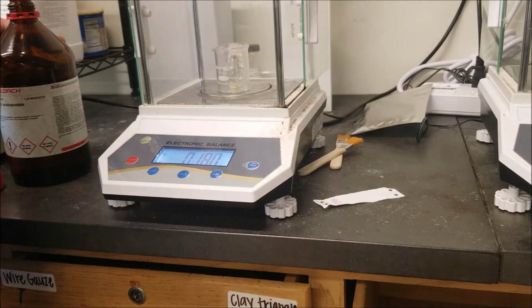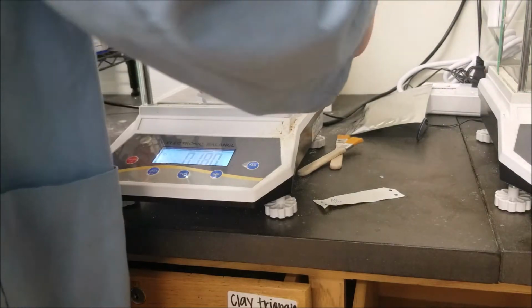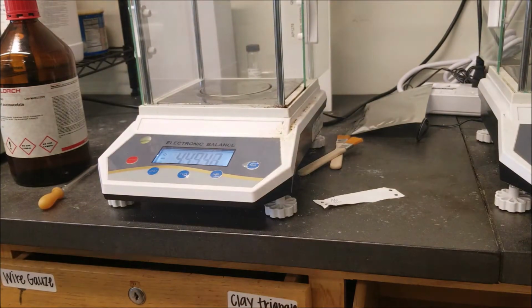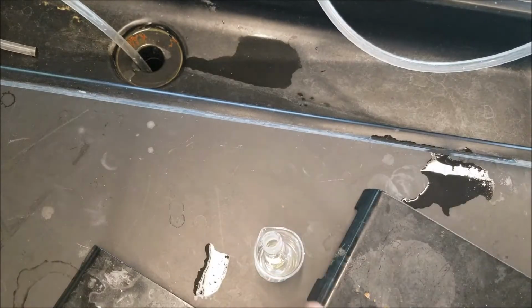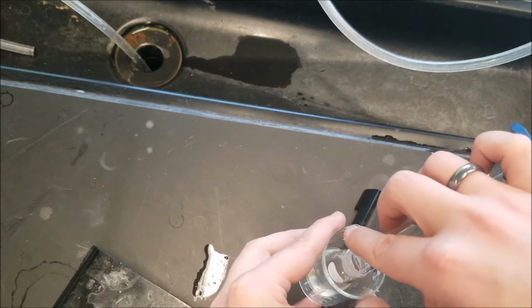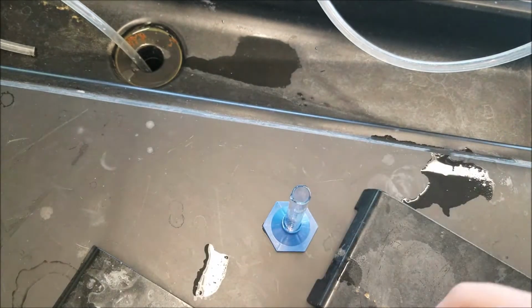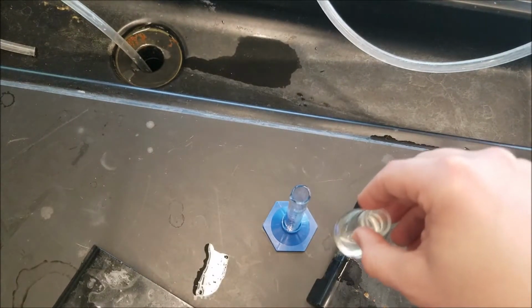So I've added a little bit too much, but that's fine. It's now 0.180 grams ethyl acetoacetate. Now I'm going to add about 5 mLs of absolute ethanol into there, and swirl until it appears to be fully dissolved. And since they're all liquids, it shouldn't take too much.